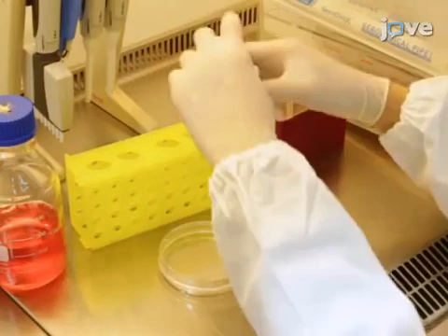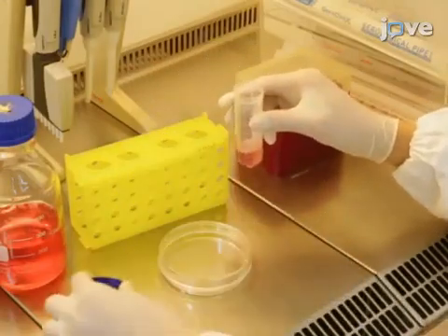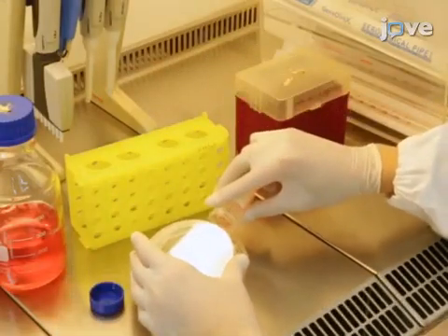Plate the cells in a 10-centimeter culture dish for a 30-minute incubation at 37 degrees Celsius and 5% carbon dioxide.